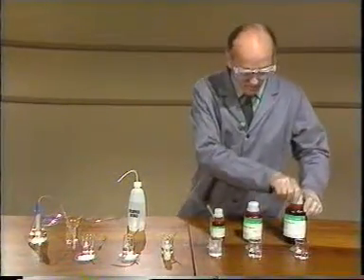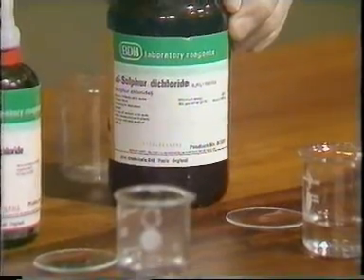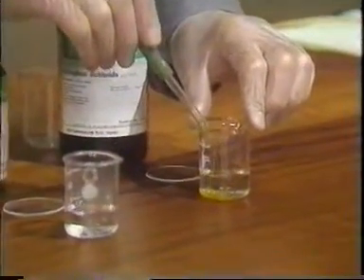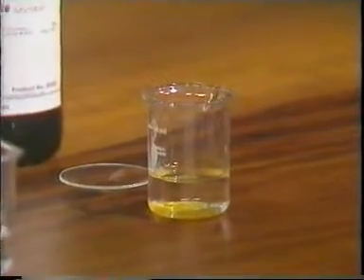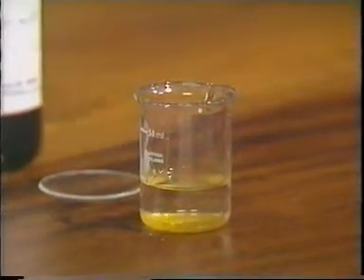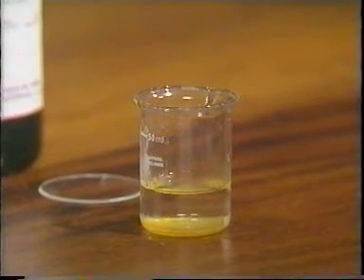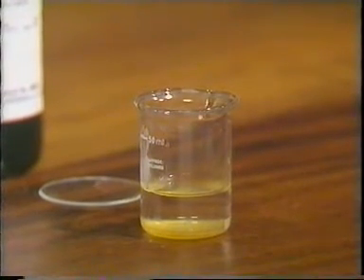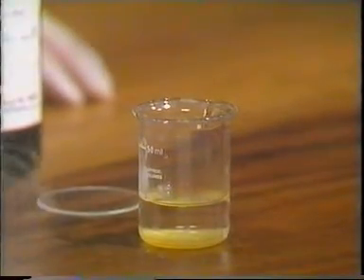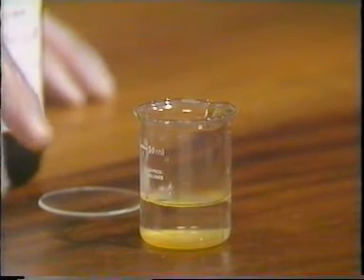Lastly, we have disulfur dichloride. And this is a yellow liquid. And when I add this to the water, there seems to be little reaction at first, but you can see the water going slightly cloudy, and also if you look closely at the junction between the two layers, there is some sign of a reaction. The fumes you can see coming in are from the phosphorus trichloride, which is still going strong.